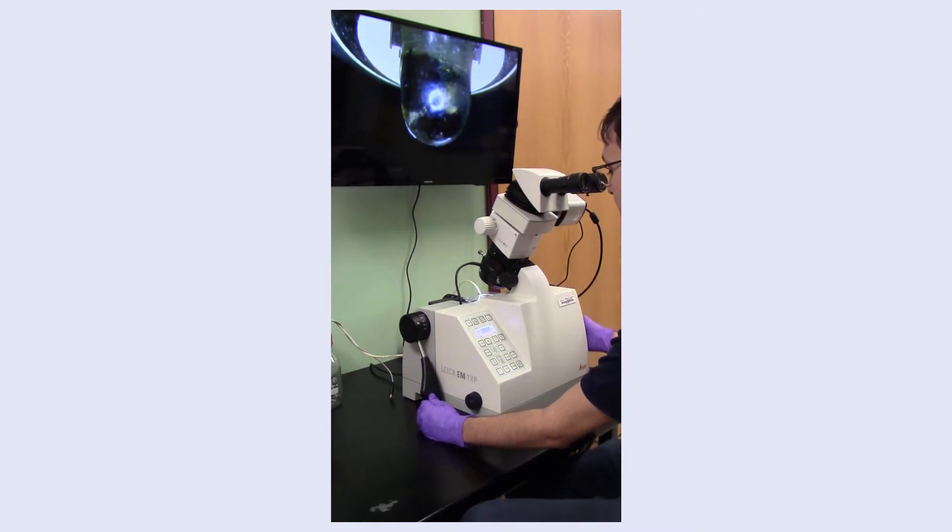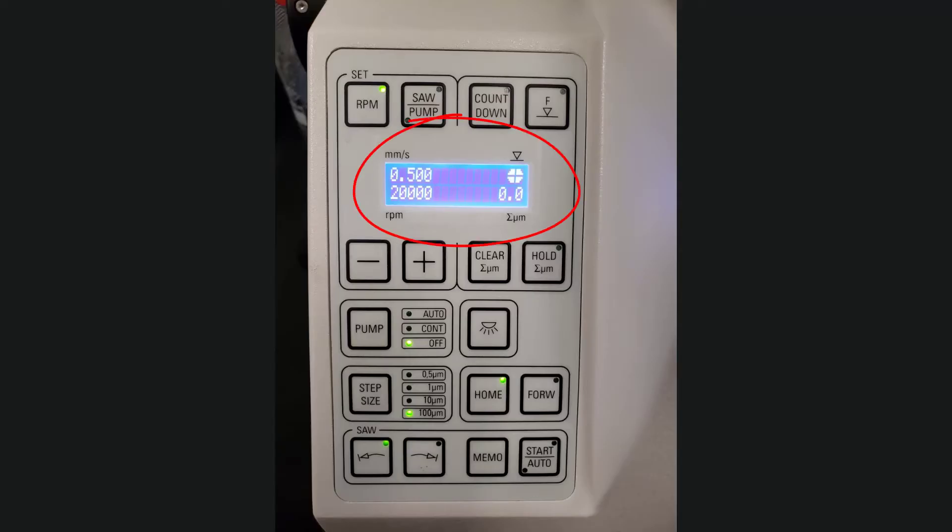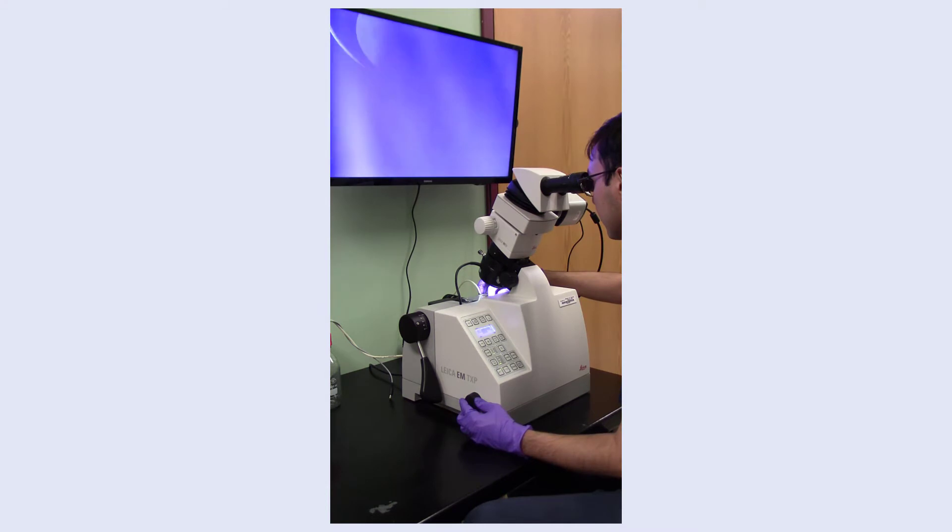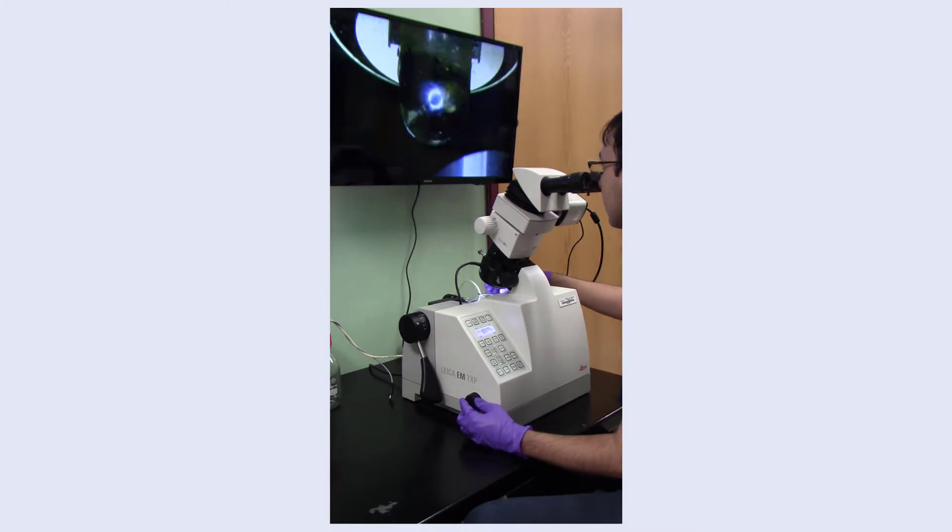On the control panel, check that the RPM is set to 20,000 and the step size is at 100 micrometers for sample approach. Move the control lever directly in front of your sample and begin approaching the sample by turning the feed wheel counterclockwise. Stop the approach when relatively close to your sample and manually turn the miller attachment by turning the spindle head such that the tip of the miller is level with the top of your sample.